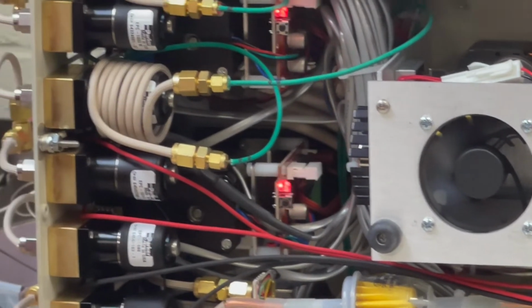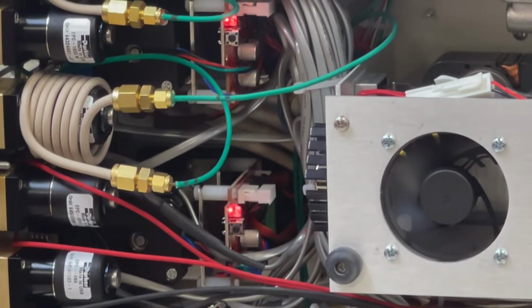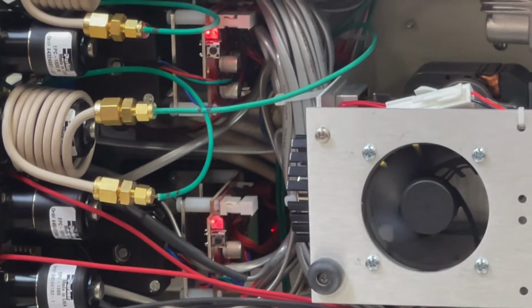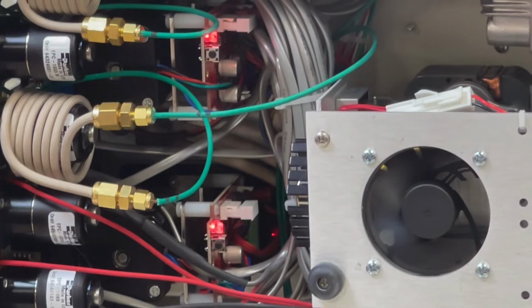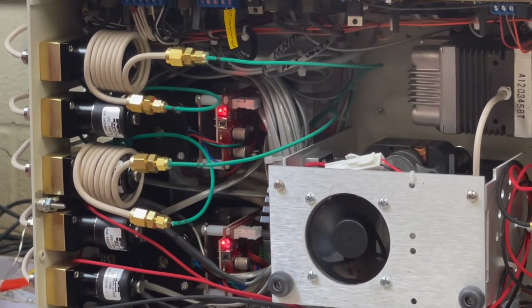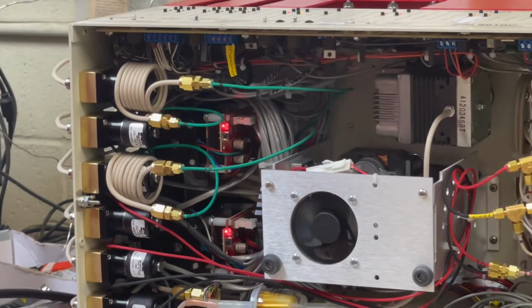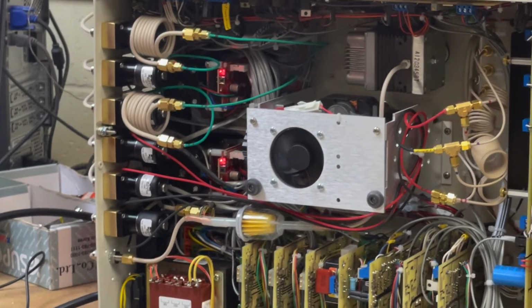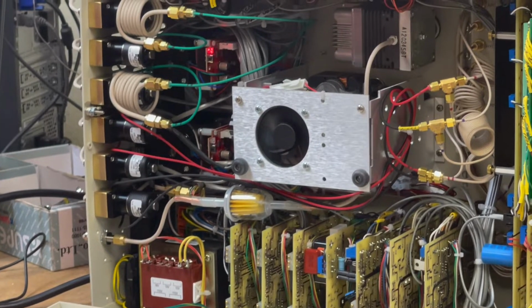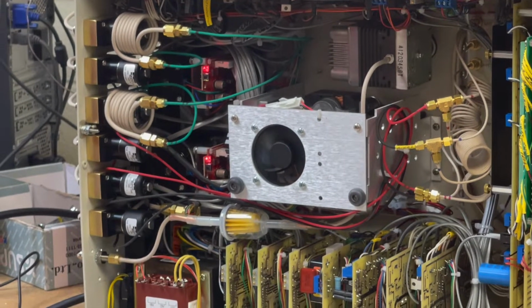And if you zoom in on this, you can hear the noise. So it goes like this for about 30 seconds, kind of rah, bonk, rah, bonk. And then it makes a couple of different sounding noises. I think it's almost done. Okay, I think it's done.